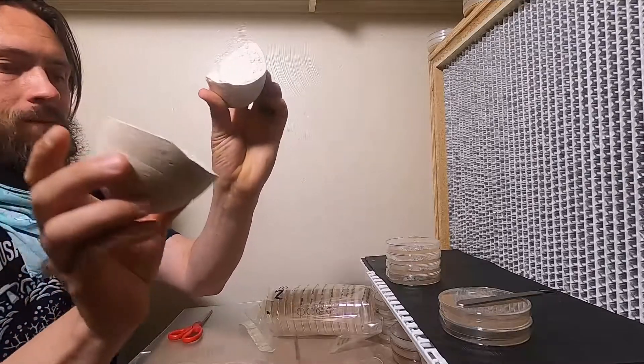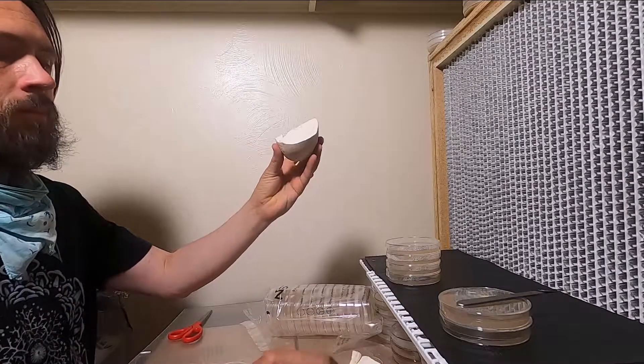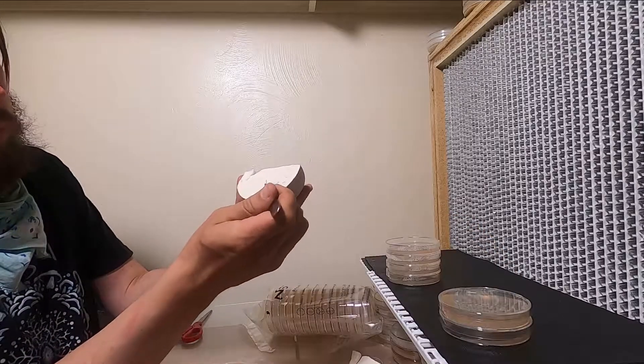And there you have it. Really clean, beautiful tissue on the inside. I'm just doing this hours after it was collected.